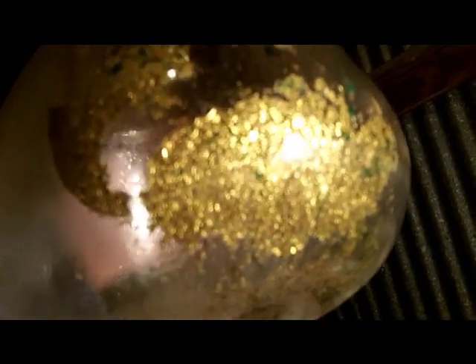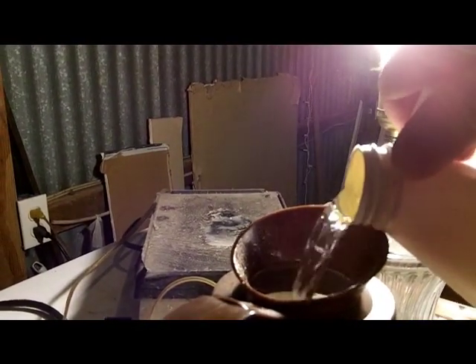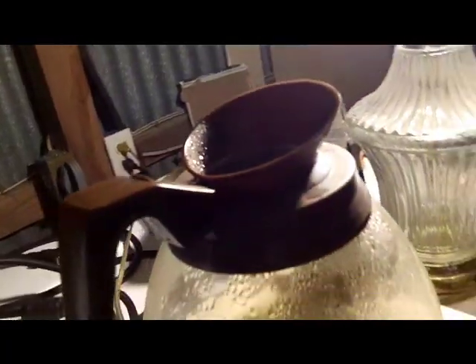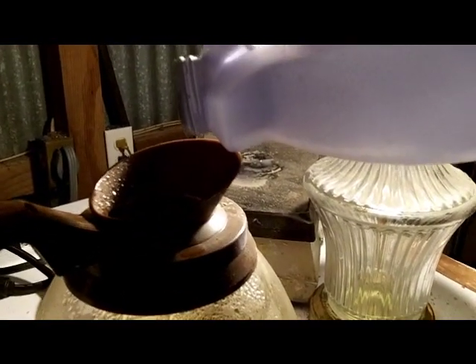We have all this gold in there — looks good, these are foils. We're just gonna dissolve a batch here and filter it. So add regular hydrochloric acid from a swimming pool supply store, like so. Then we add some regular unscented Clorox bleach — just a few drops. Oops, got a little extra. Gonna put a watch glass over that to hold it down and get all our gold mixed around in there.